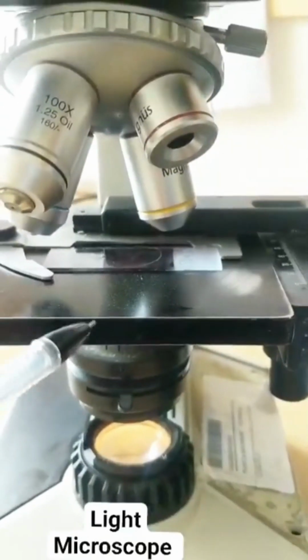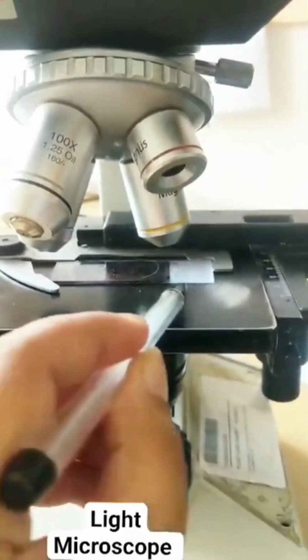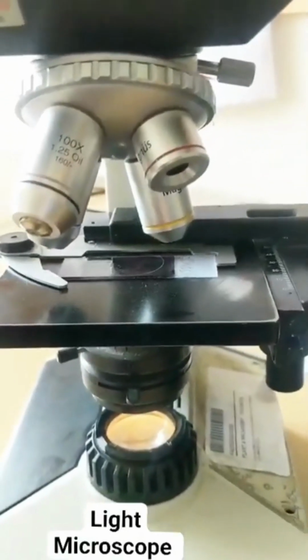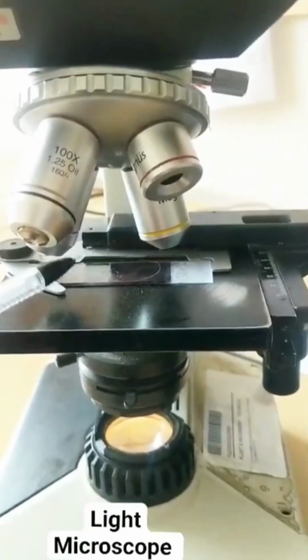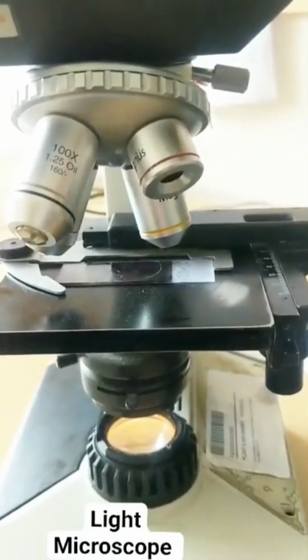Where does the light enter? The light enters here. What is this? This is the stage. So you notice I've kept the slide on a stage. Now, after the light enters, the light comes out. Light passes through the slide and whatever specimen you've kept over here.